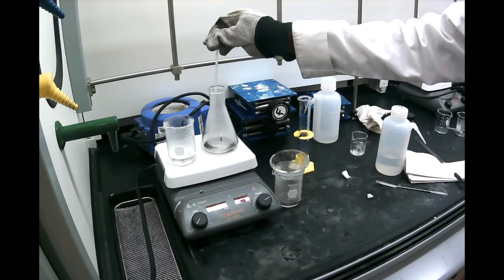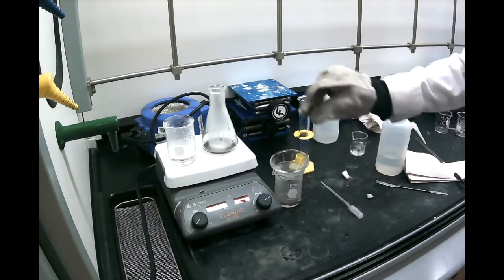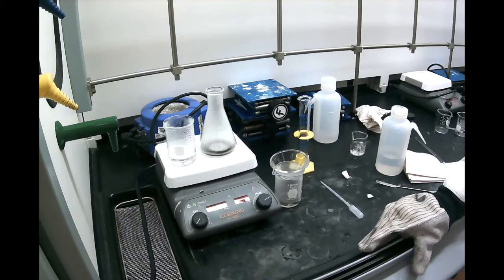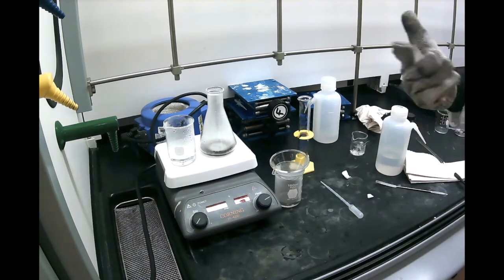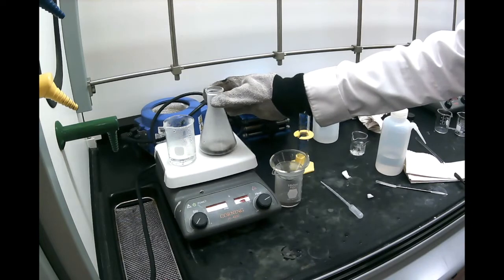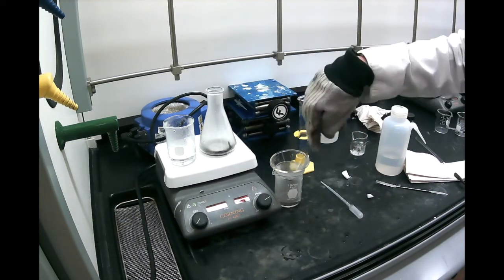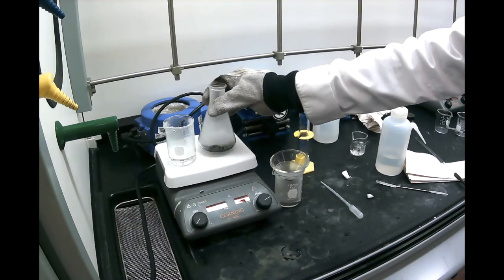And of course, if you do it the first time, you might be lucky and it works pretty well, but don't feel bad if it doesn't work very well, because that's really what recrystallization is all about. It's really an art, basically. It takes practice to get really good at it. And you can see, as I keep filtering, I kept on adding water because I don't want it to run to dryness.